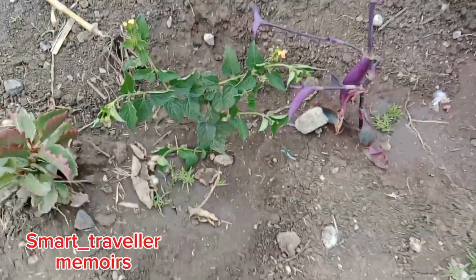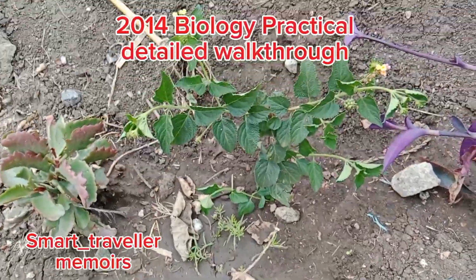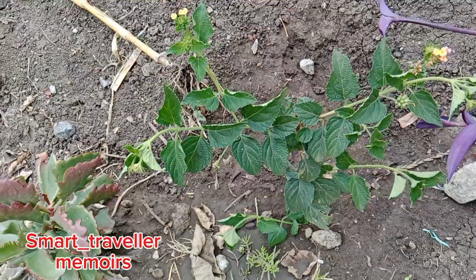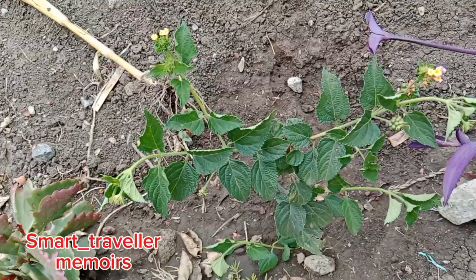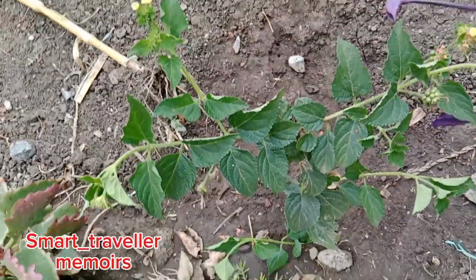So guys, here we have two plants, and these are the ones I'm going to use in my presentation. So we have the Lantana Camara here.